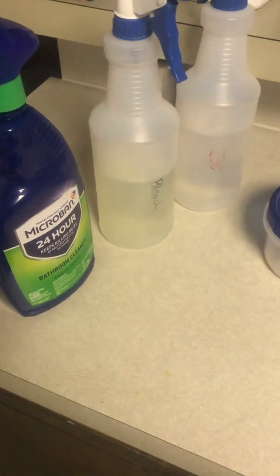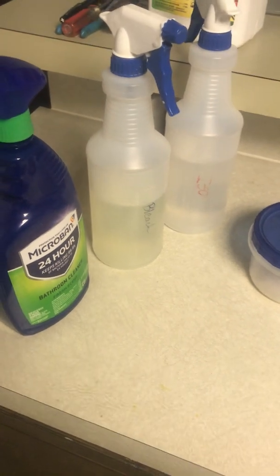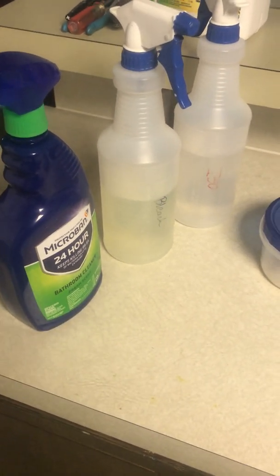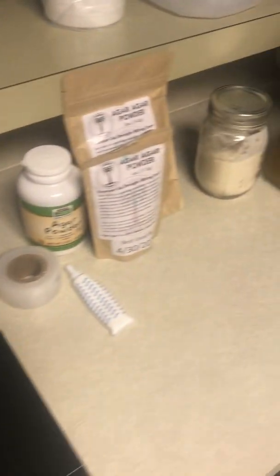Hello, I'm making this video because I wanted to show how I do agar for growing mushrooms. One of my friends told me that he was interested in growing some mushrooms, so I just wanted to show some of the basics and I'll talk about this stuff briefly.